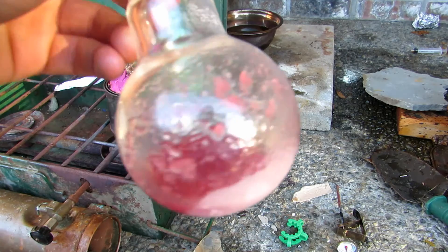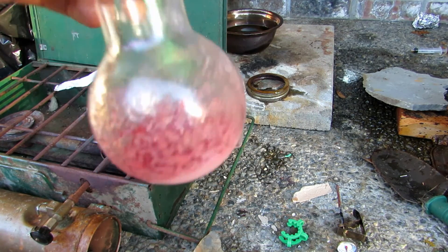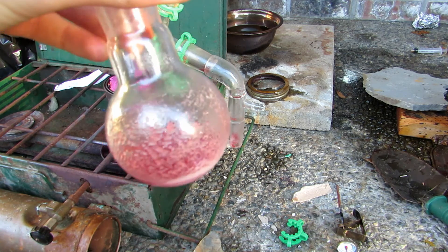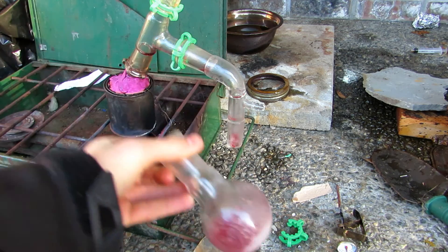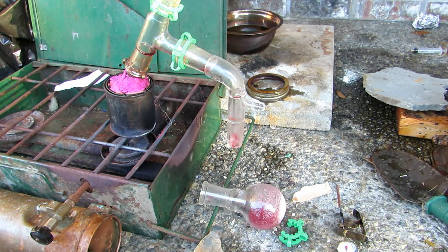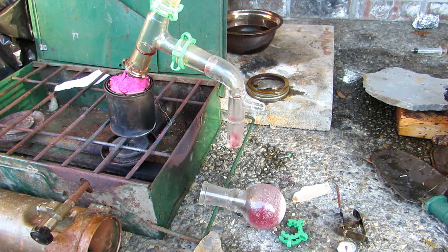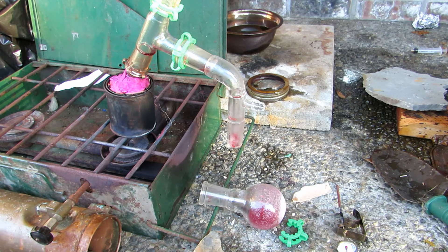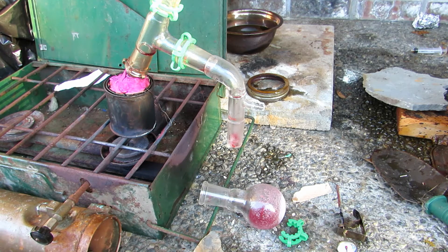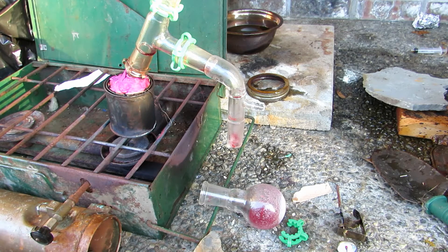In our receiving flask, we have some really nice white phenol which has crystallized out. But we also have this goopy, watery dye layer, which is a mess. I'm going to take the rest of this apparatus, clean up our glassware a bit, and then set up for a normal short path distillation. This time we'll be able to remove the water, hopefully remove the dye, and be left with a nice pure phenol product. I'll also open up the can to show what's inside.